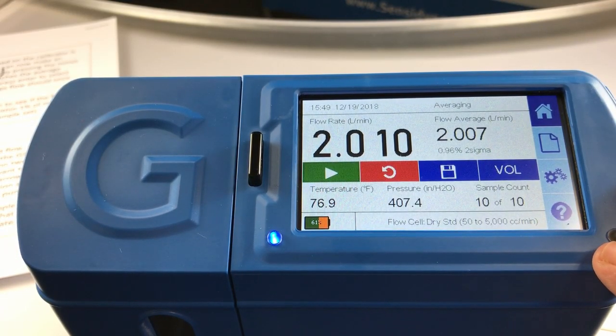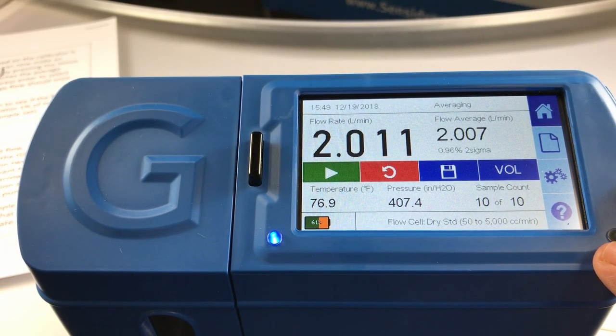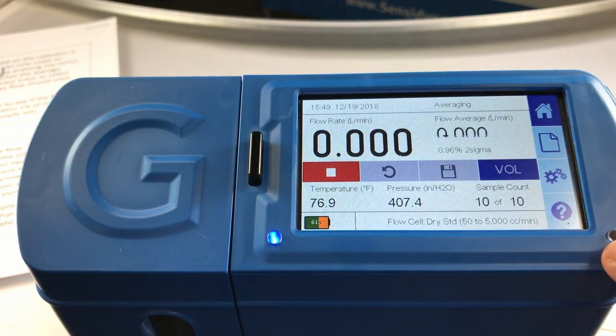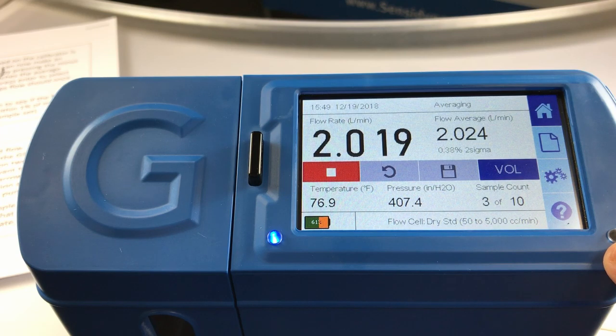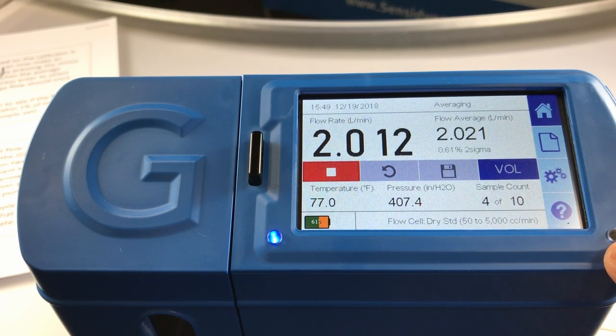I will once again repeat the 10 sample set average by pressing the play button. Now that I have verified the pump flow rate to be accurate, I want to record my calibration data.